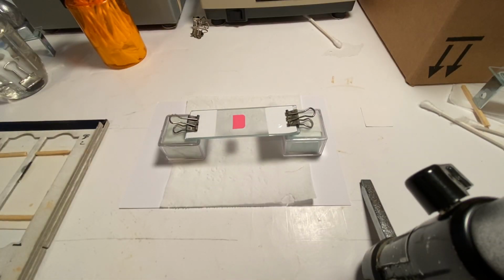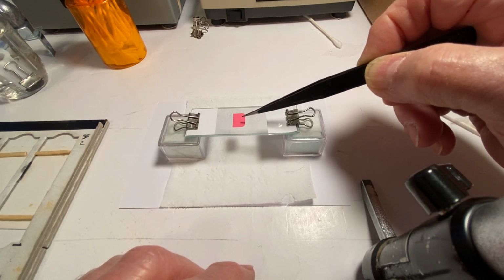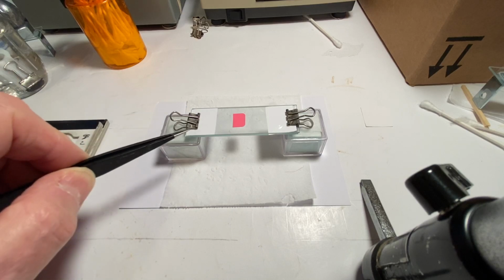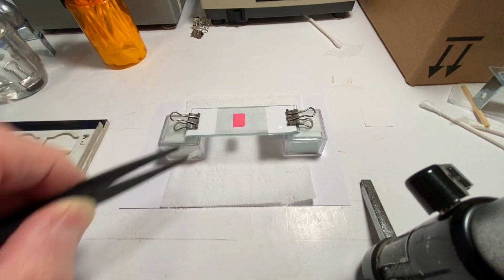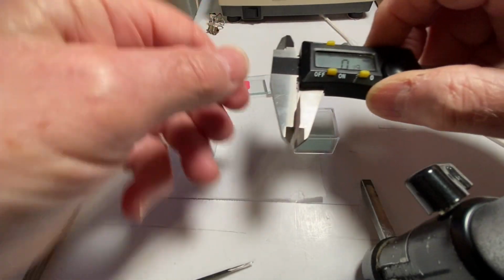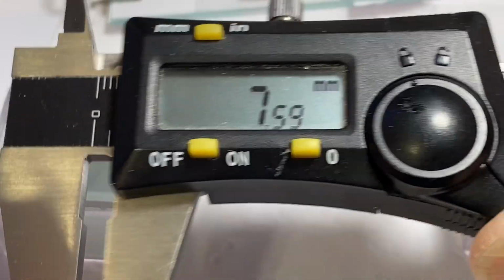So I'm going to skip ahead a little bit, and I've cheated on this example here. I was going to use a spider, but the first dry run I tried took so long, me manipulating, I decided to just cheat a little bit. So what I did was I took a piece of pink sticky paper and put it in the middle. That's our insect. And then we have our glass slides, two glass slides held together with small paper clips with a paper shim in between so that the insect can't be crushed too much.